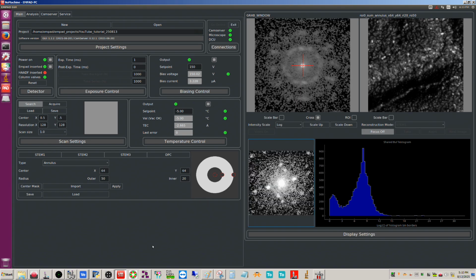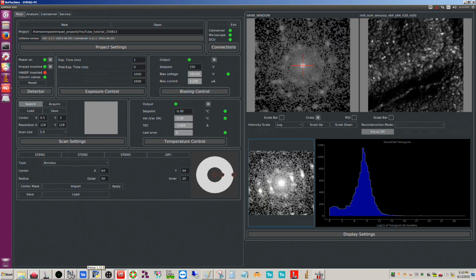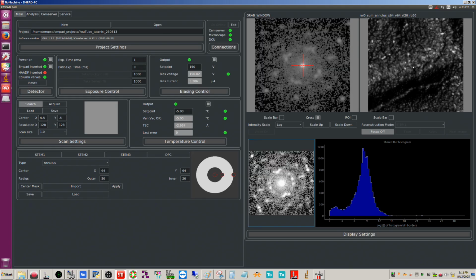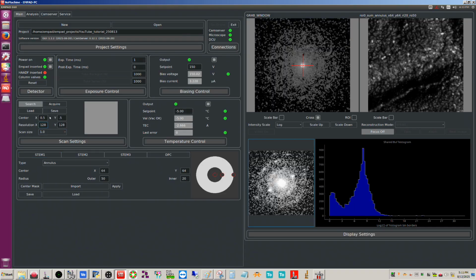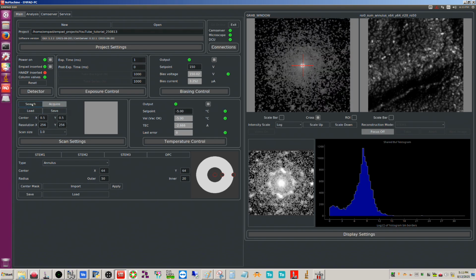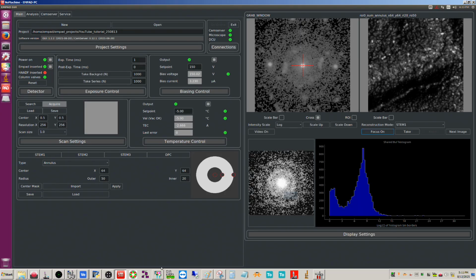So anyways, that's the search mode. You can use this to determine the area that you want to scan. I would center that rather than try to move the area here. I would just center it and then make adjustments from there. Can we switch to acquire? Yes. Right now it's using the search settings. Let's go ahead and click focus off here. It's going to stop the scan. And let me blank the beam so I have a shortcut. I'm just using my R2 button.